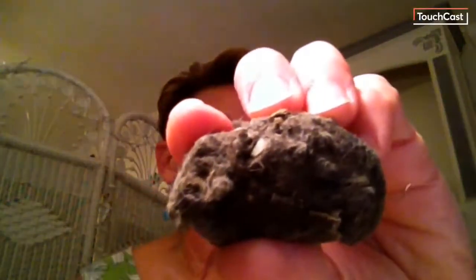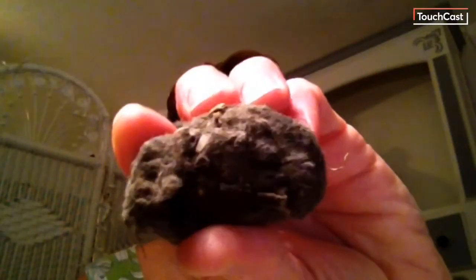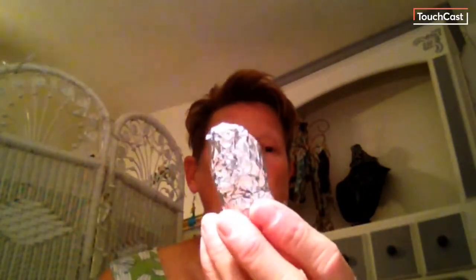I'm going to put our little owl friend away for a minute. A pellet actually looks like this — you can see there's bits and pieces of stuff in there. The pellets I got came wrapped in aluminum foil and they were fumigated and sterilized, and they come from a company. But you can actually find owl pellets in the wild.